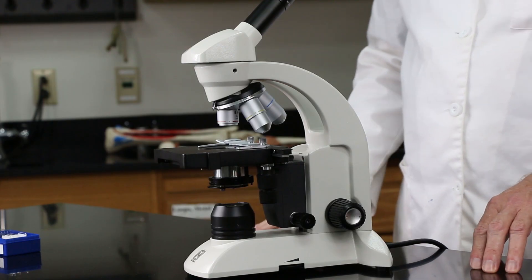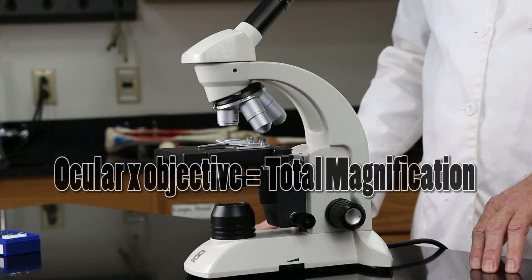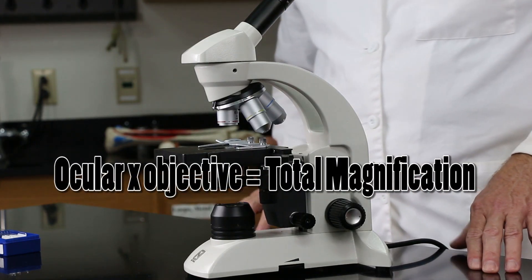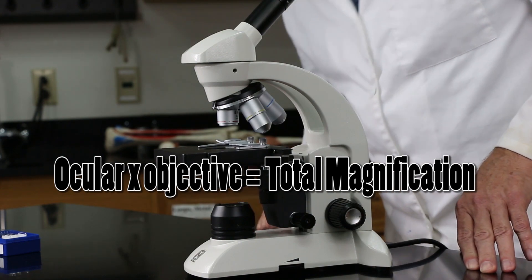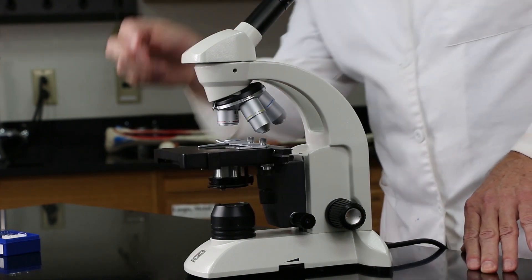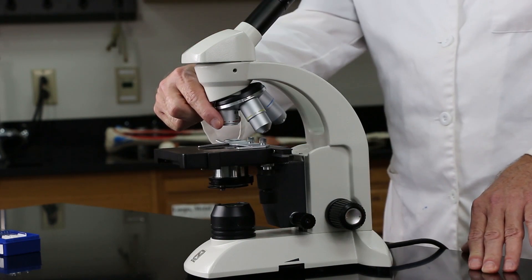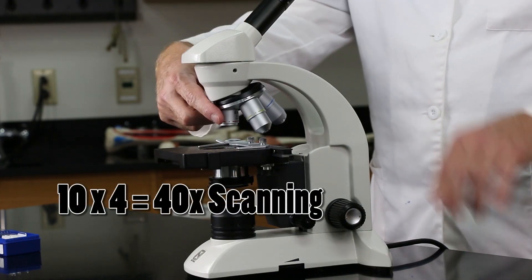Total magnification is ocular times the objective. So, if I have been selected to the scanning lens, 10x4 is 40, okay?